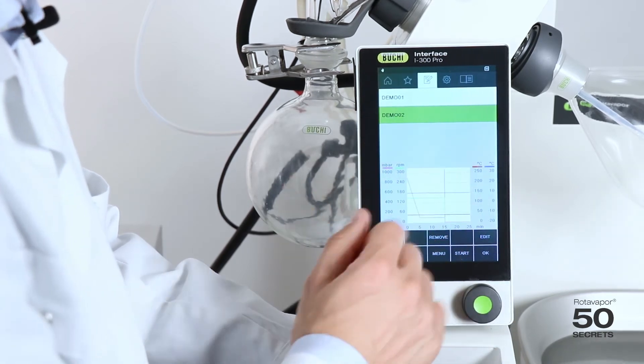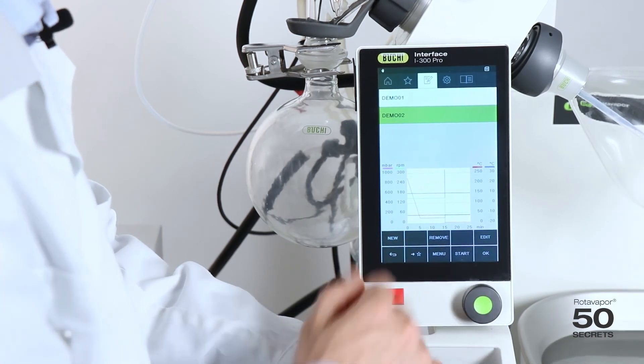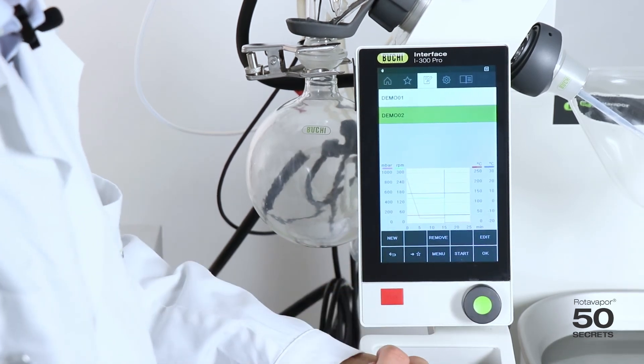Once I'm ready or once I'm happy with this method, I can just press start and the method will exactly run the way I programmed it.